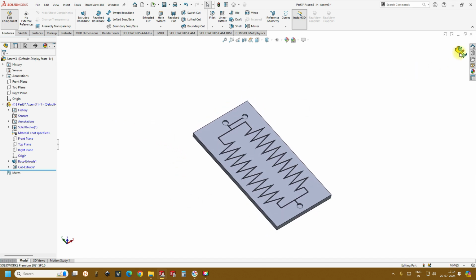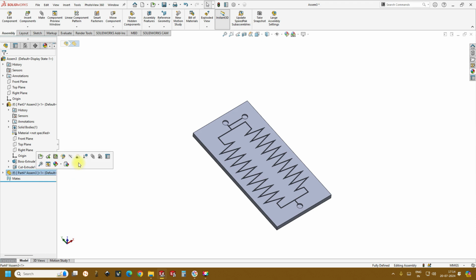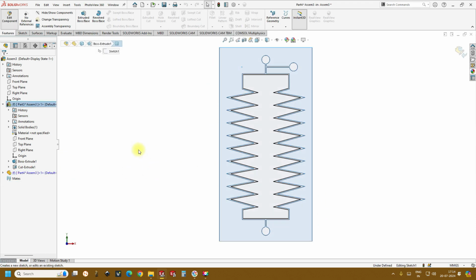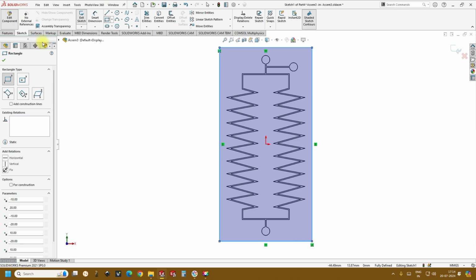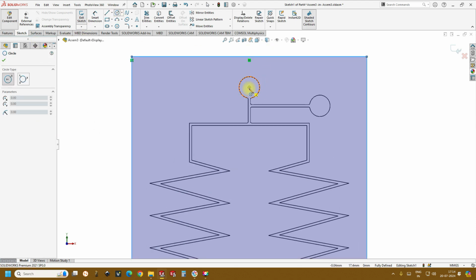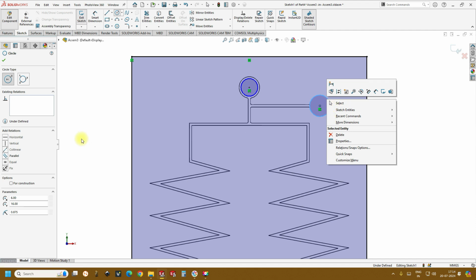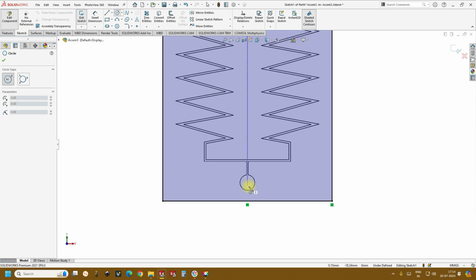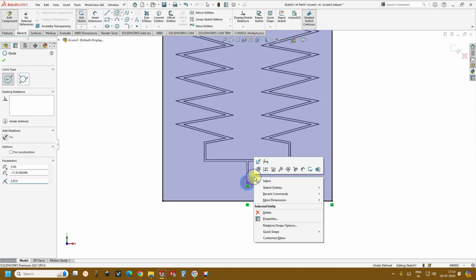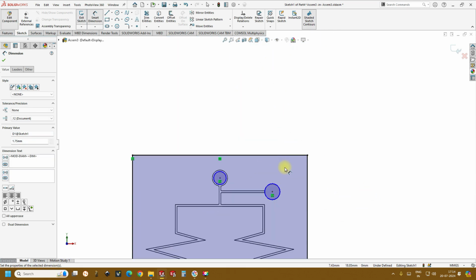Now what we do is just come out of sketch, go to new part, create a new part, edit the part, select the surface. Now let's create the covering, the top covering. Similarly to the outlet. Let's give the dimensions to all of them. 1.75, 1.75 and 1.75.